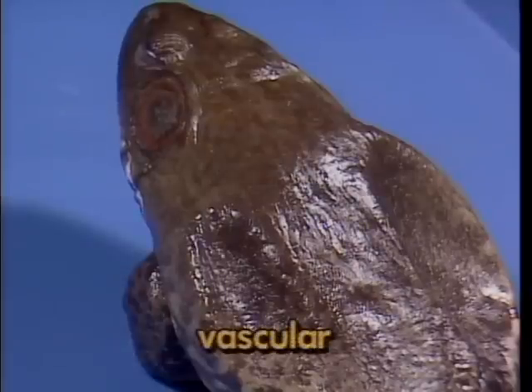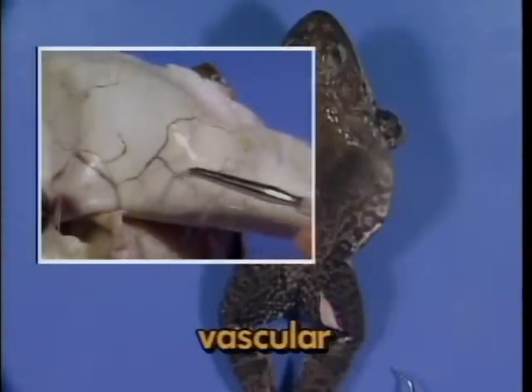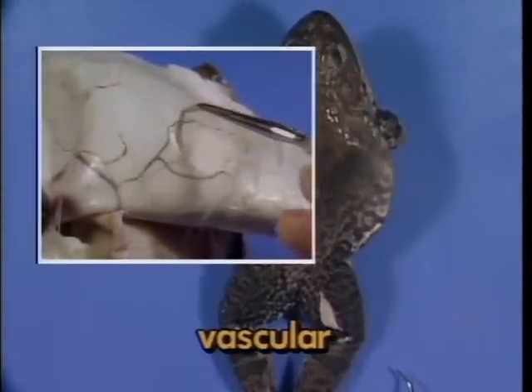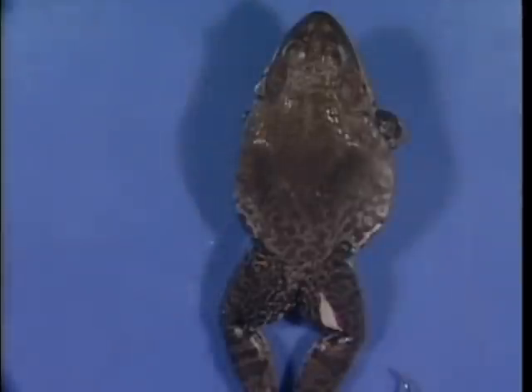Because the skin is very vascular, or filled with blood vessels, frogs are also able to obtain oxygen from both the air and water. This capacity allows bullfrogs to spend the winter on the bottom of ice-covered ponds. Under these conditions, all of the oxygen needs can be met through the skin, and the lungs won't be used again until spring, when the ice cover melts and the frogs emerge.